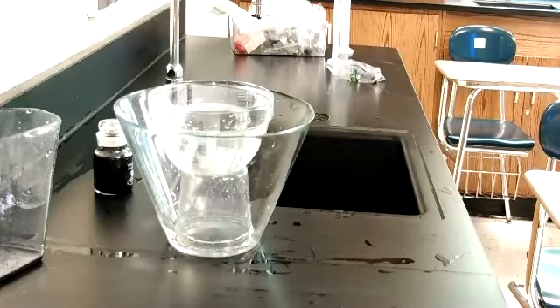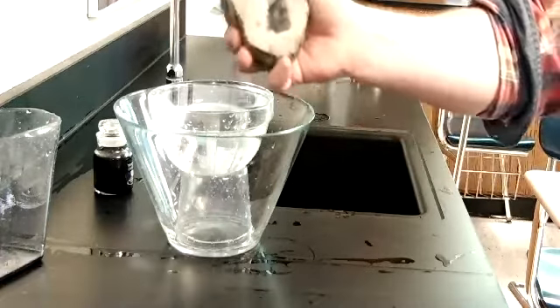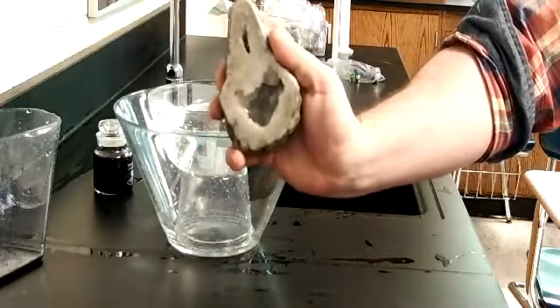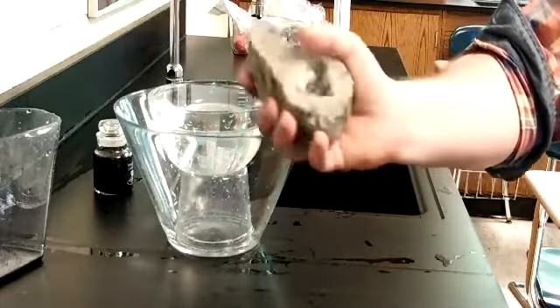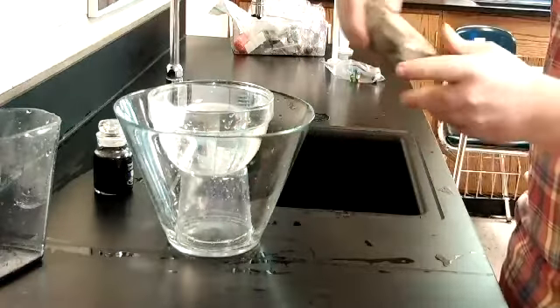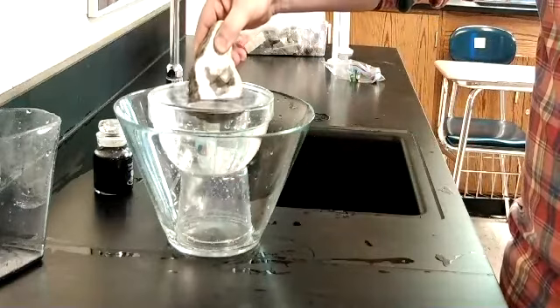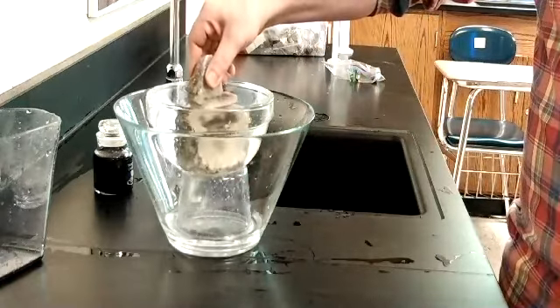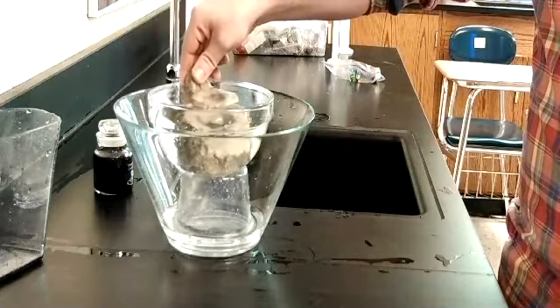Oh, now I want to do more things, like this rock from my rock collection. It's a lovely little crystal geode, a little bit different from the one I showed off earlier. I got to be careful because all my stuff is glass. So I'm going to lower this in there very carefully. I can already see some things displacing.